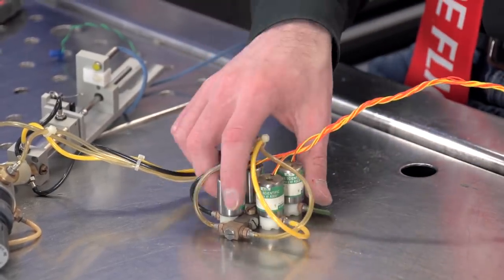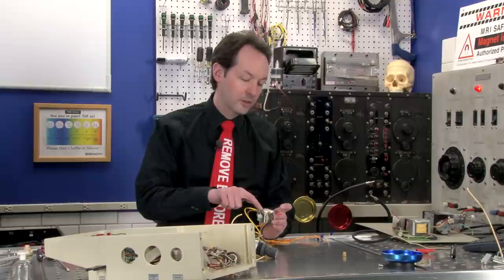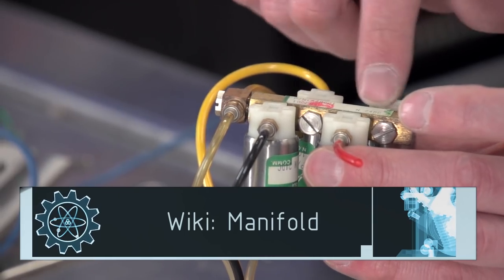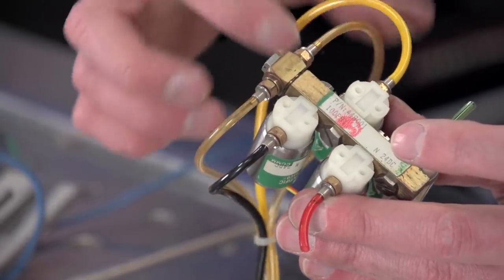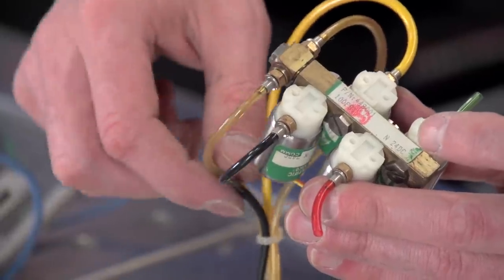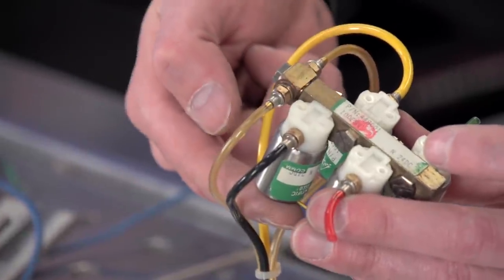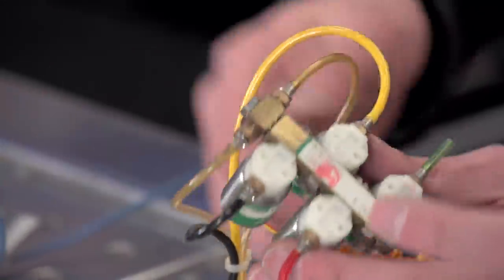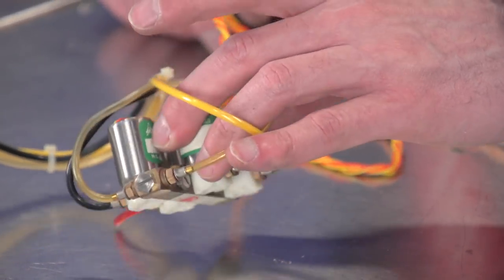Now, these are labeled Angar Scientific, a subsidiary of ASCO. And they have 100 psi on them. And then N24DC. So these work on 24 volts DC. But what these are, are little tiny valves. And they're on, they share this center bar, which is a manifold. One of them is the supply side. So this is where our gas, like compressed air going in, goes. And then when you apply electricity to the coil on one of these valves, they're like a little solenoid valve. That trips the thing, and then the air can come out and go down the wire, or the tube.